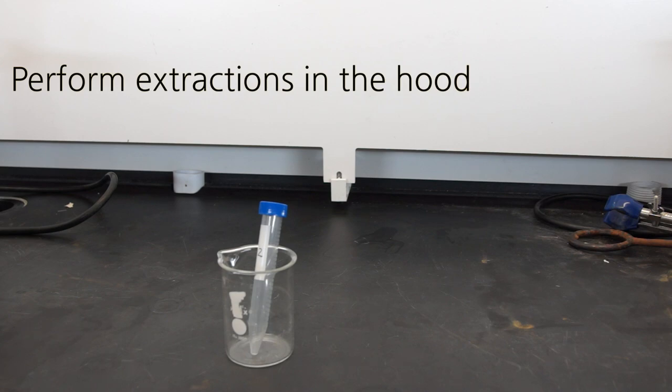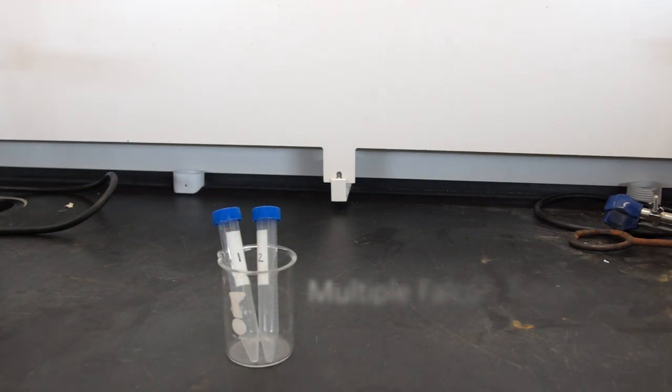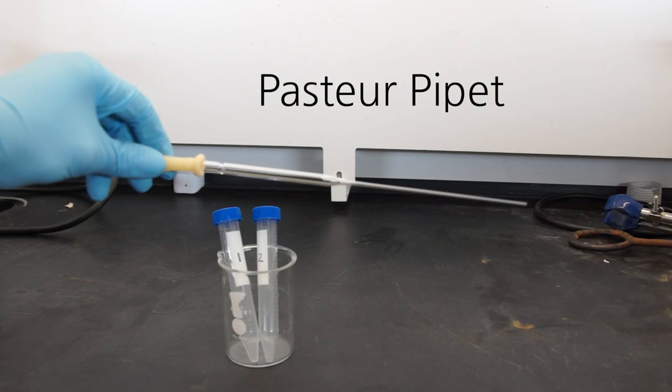Remember to wear gloves and perform extractions in the hood. Here's what you'll need: some falcon tubes and pasteur pipettes.